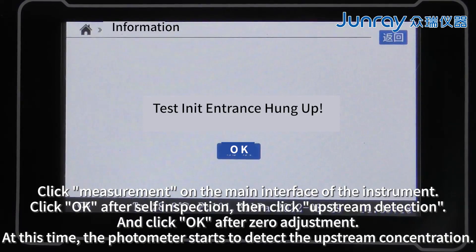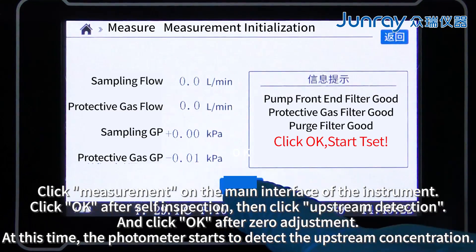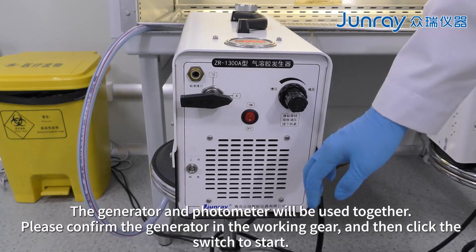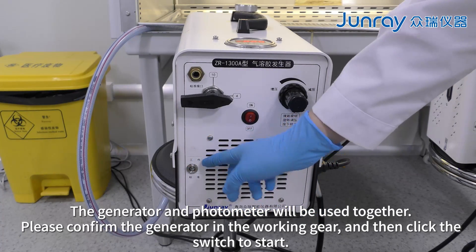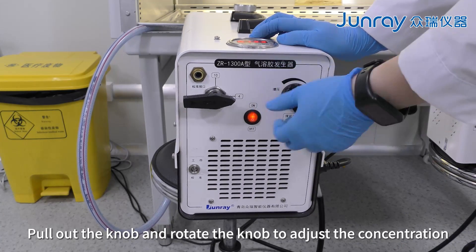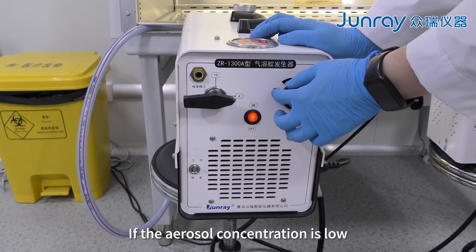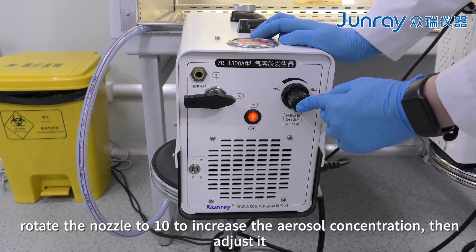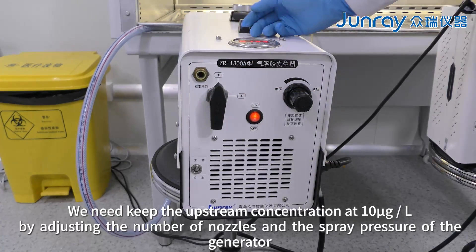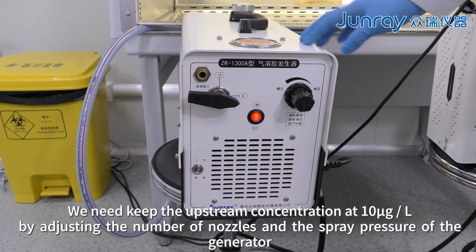Click measurement on the main interface. Click OK after self-inspection, then click upstream detection, and click OK after zero adjustment. At this time, the photometer starts to detect the upstream concentration. The generator and photometer will be used together. Please confirm the generator is in the working gear, then click the switch to start. Pull out the knob and rotate it to adjust the concentration — left is pressurization, right is depressurization. If the aerosol concentration is low, rotate the nozzle to 10 to increase the concentration. We need to keep the upstream concentration at 10 micrograms per liter by adjusting the number of nozzles and the spray pressure of the generator.